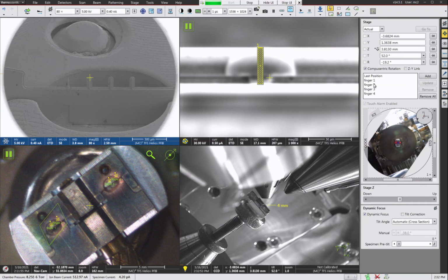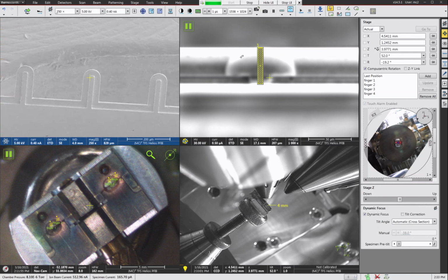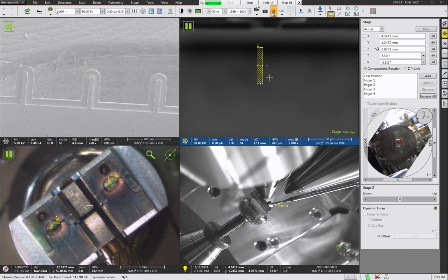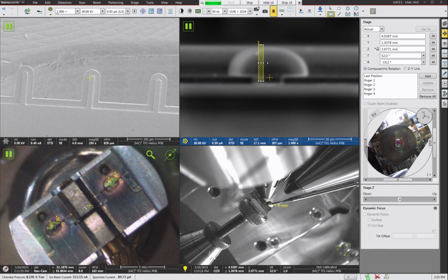And then on my second grid, if I go over to finger three, on this grid what I would do, instead of doing a single rectangle cut, is put one here, copy it, and maybe put a second one. So something like this. And then there'll be two trenches cut into this finger. So I'll have grid number one and grid number two, and those will be easily identifiable by the number of notches in the post. You'll be able to see that in the TEM, you'll be able to see that in the atom probe, and you'll be able to know which grid fingers you're looking at. And you could do any variation on this theme that you want. Just put some kind of mark in here that you can see in the profile view of the grid that makes it asymmetric.